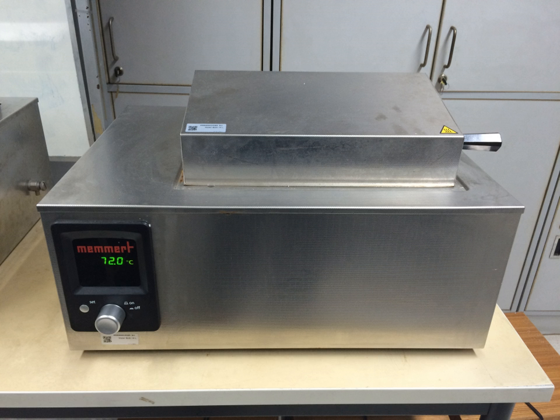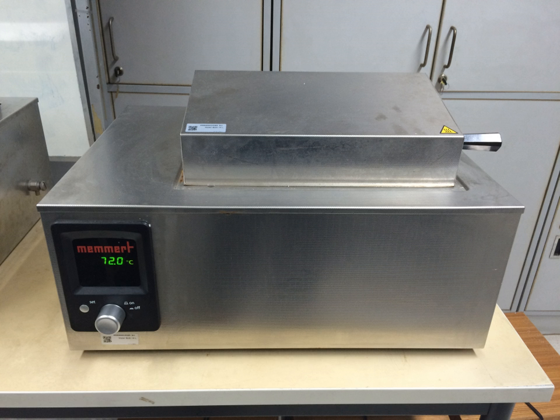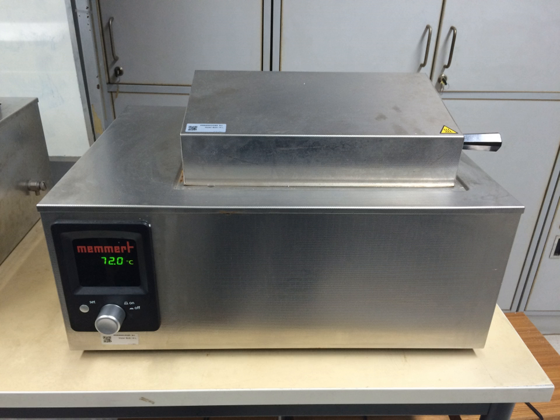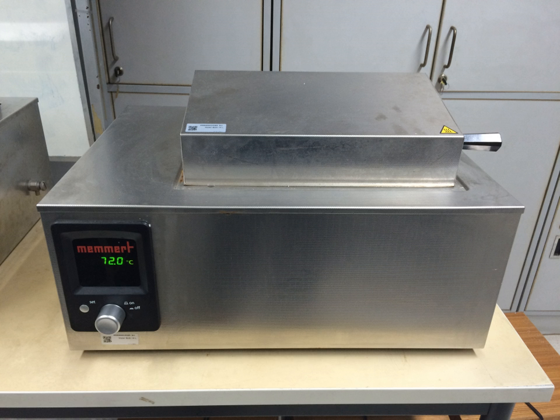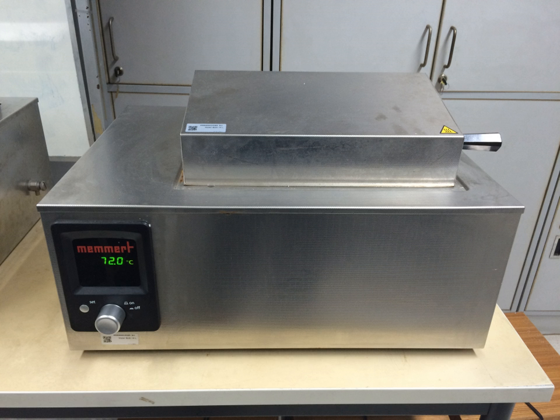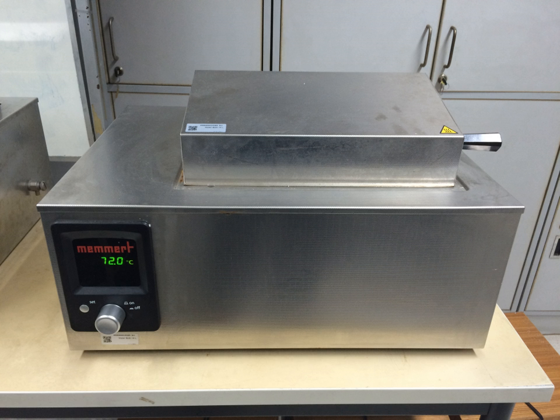A water bath is laboratory equipment made from a container filled with heated water. It is used to incubate samples in water at a constant temperature over a long period of time. All water baths have a digital or an analog interface to allow users to set a desired temperature.